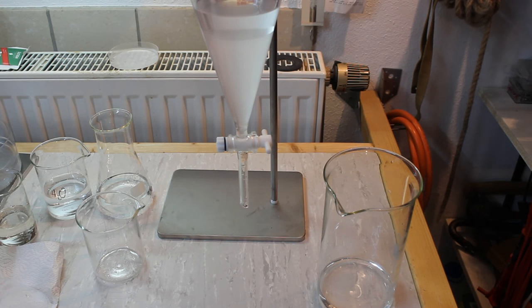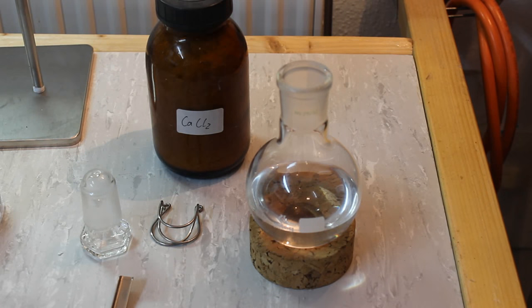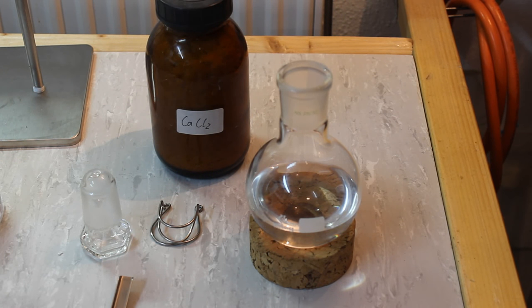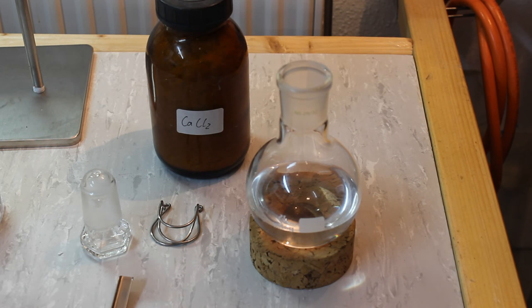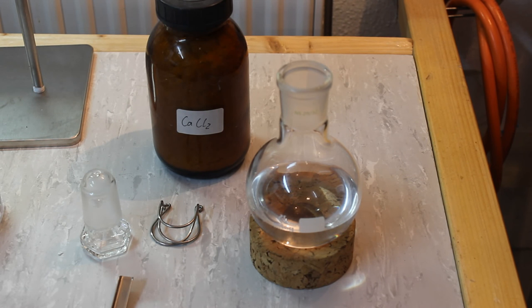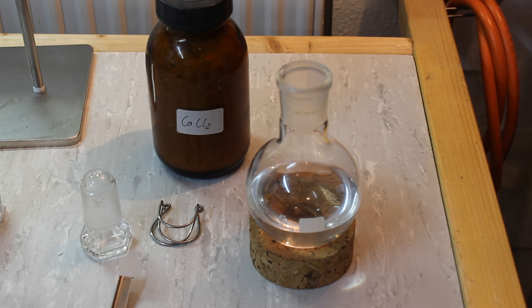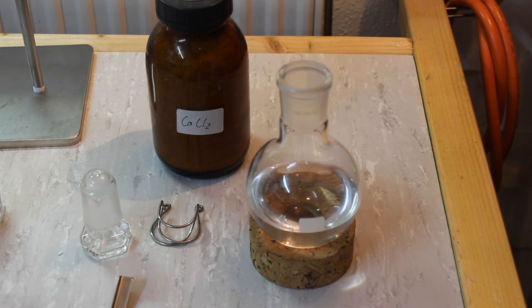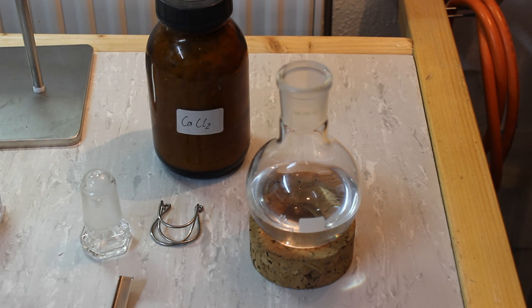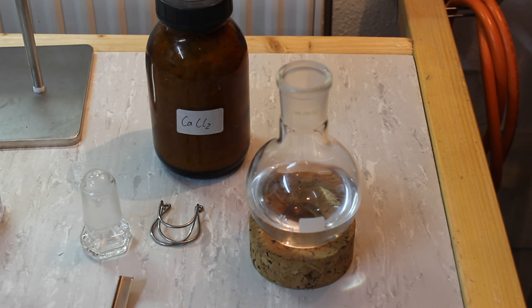Now I'm going to do one last water washing off camera. After the last water wash we're left with our final yield of 157.5 grams of bromoethane. This corresponds to a percent yield of 72.3%, which for me is totally fine, but it is quite low compared to the literature value of 90%. Since my hydrobromic acid was of unknown origin and I didn't know its exact concentration, I'm perfectly fine with what I got.